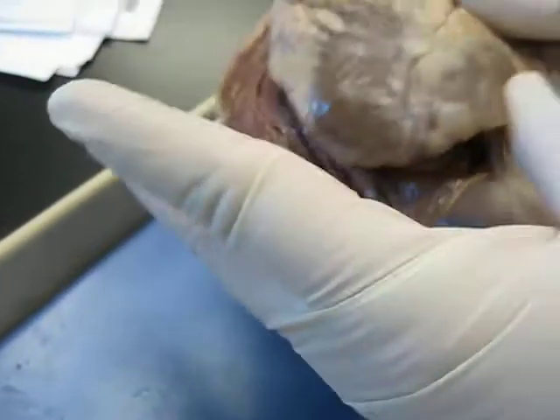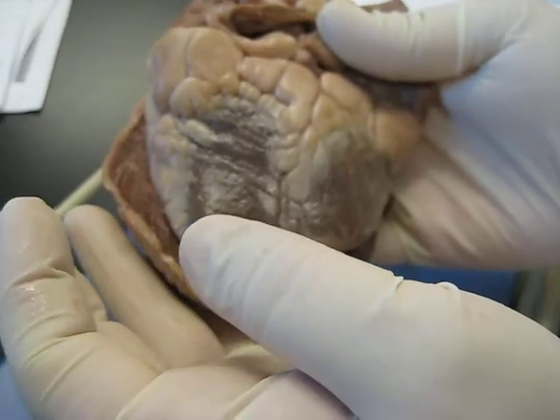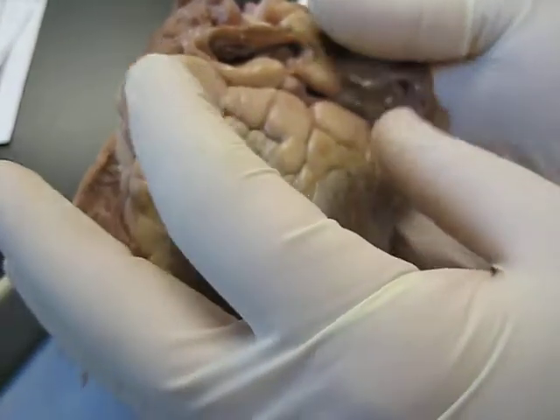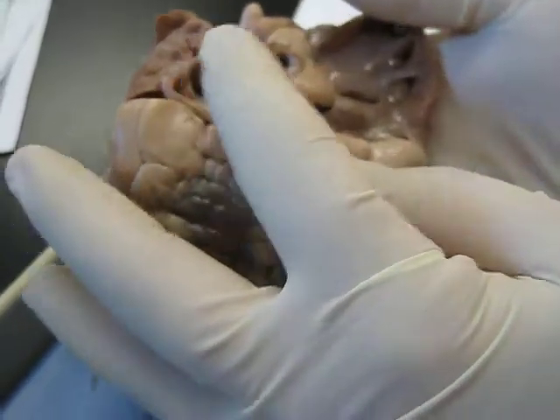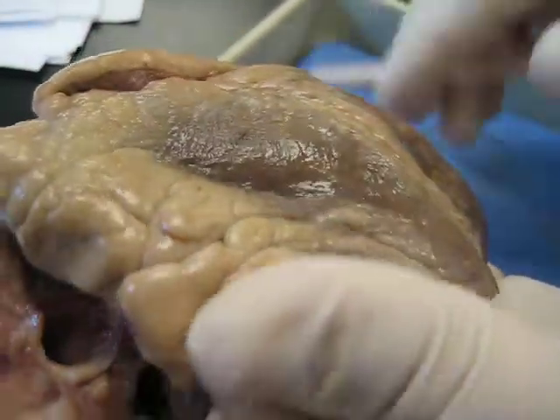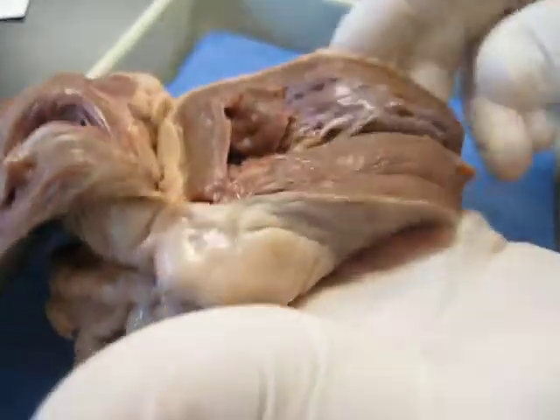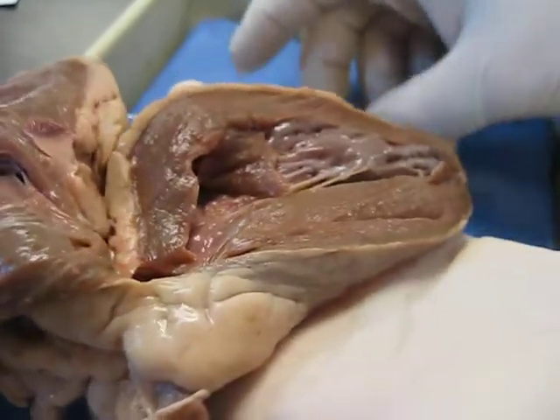If you look on the posterior surface, you have a posterior interventricular sulcus, but it's much less pronounced, shorter, squatty, not as well marked. Besides, you have vessels that are open towards the back. So this one looks like we can pretty much tell that this is anterior. And if we flip this open here, again you can tell right from left.